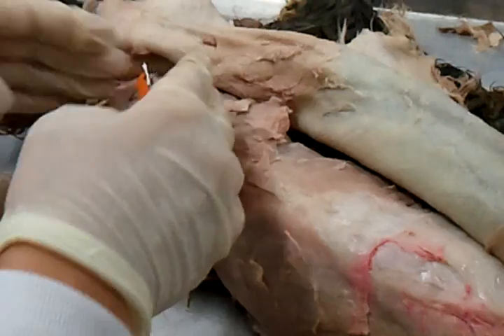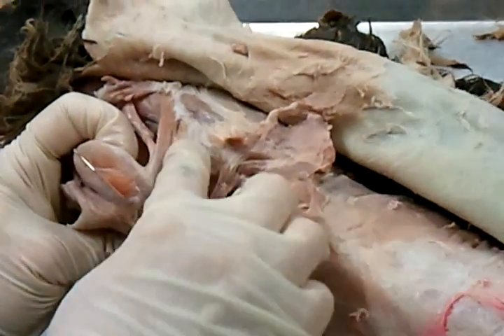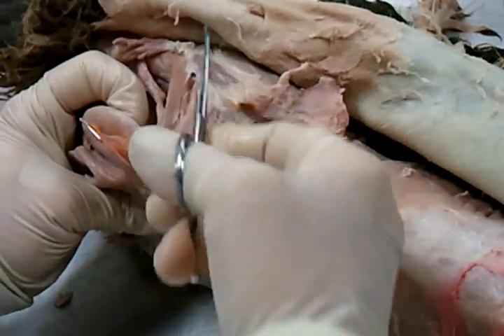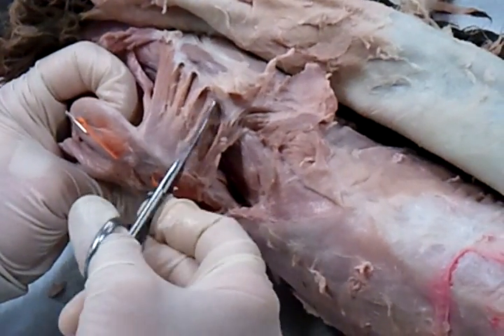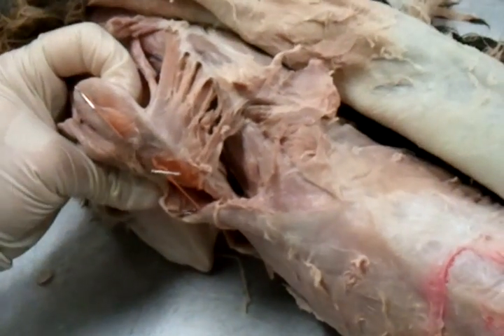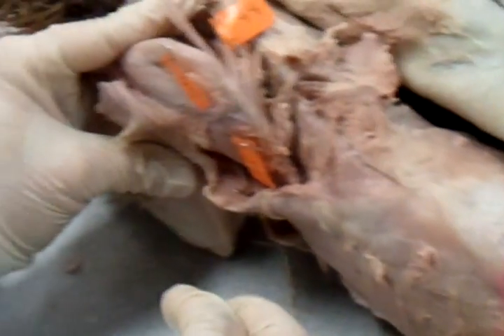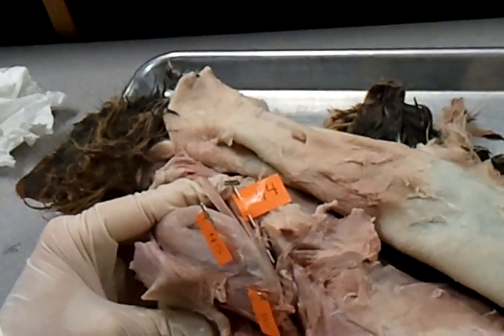Now, if you look, there's a whole bunch of muscles holding the scapula to the vertebrae, right here. Do you see all those? These ones right here have a flattened rectangle shape. Do you remember what that shape was called? Rhombus — rhomboids. These are your rhomboids right inside here. All of these are your rhomboids. So that whole group is called rhomboidus, except for one special one on the top, which is called the rhomboidus capitis, meaning going to the head.